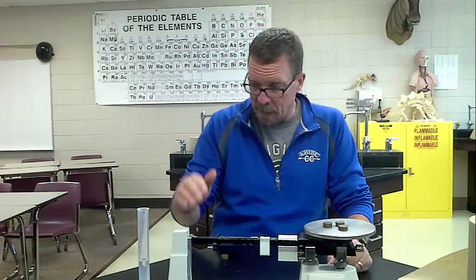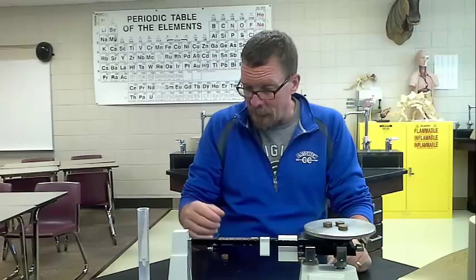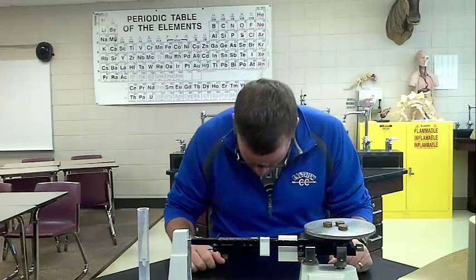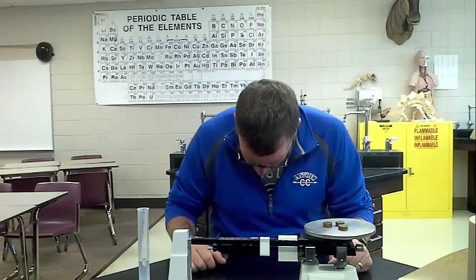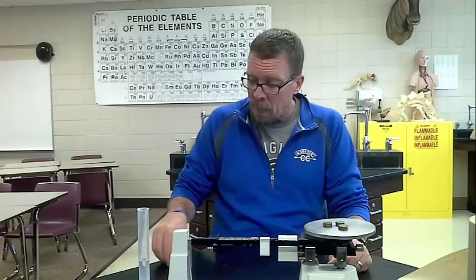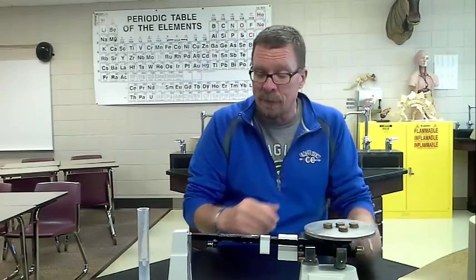I'm looking to see, I don't have to wait till the line actually lines up, if it's kind of moving in the same range. We're at 45.79. And then one more time, I'll put on the final 5, and that's set.